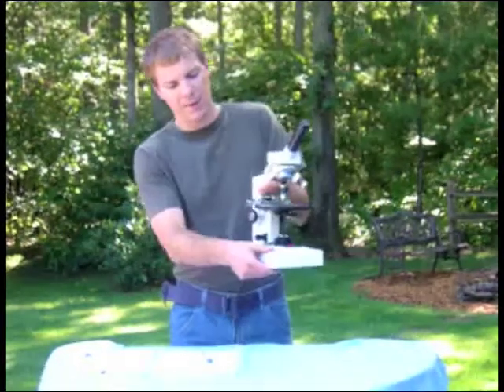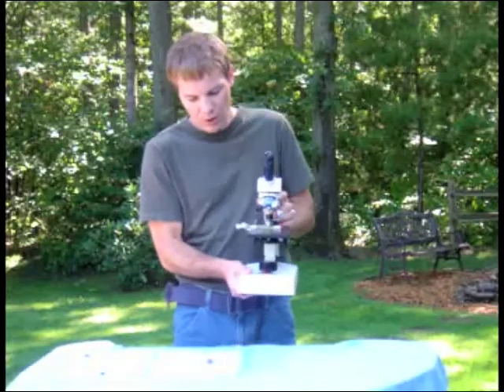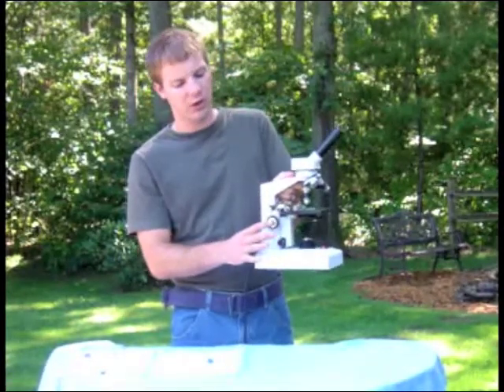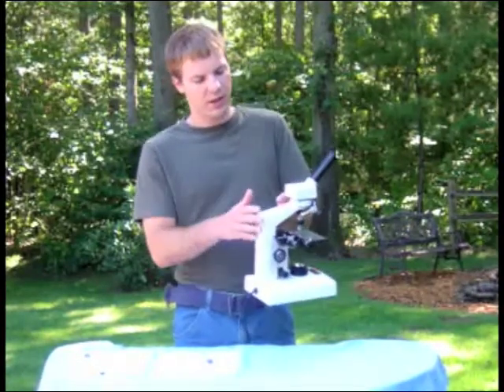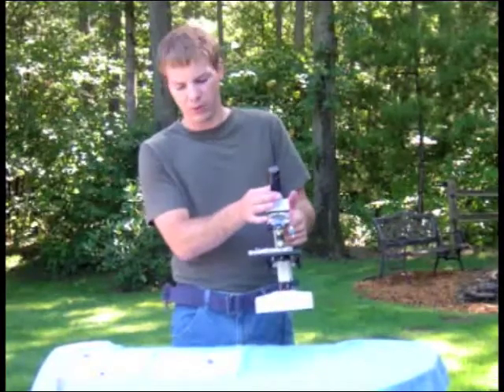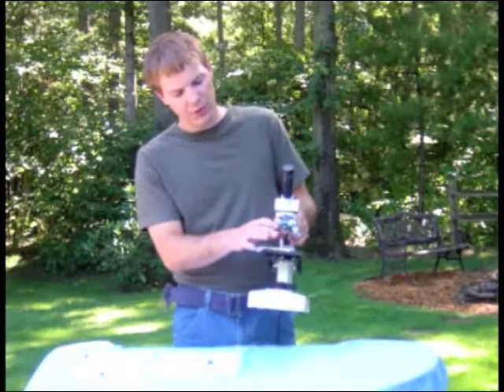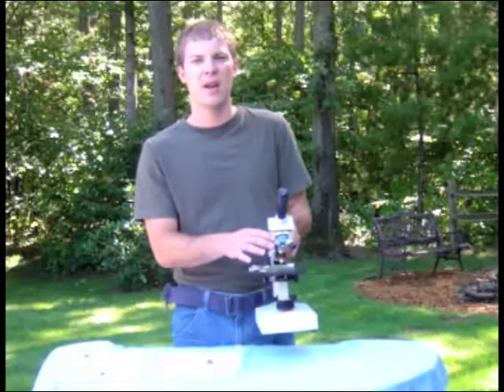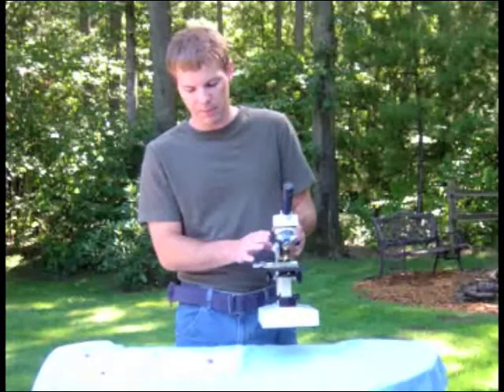At the bottom we have the base, and this is where you'll set your microscope down. Above that there are two focus adjustment knobs — there's a large one and a small one, and we'll talk more about those later. The arm is what comes up from the base. Above that you have the eyepiece that you'll be looking into, and then this microscope has three objective lenses. Some microscopes have four objective lenses, but for the most part we'll only be using the three on this microscope.